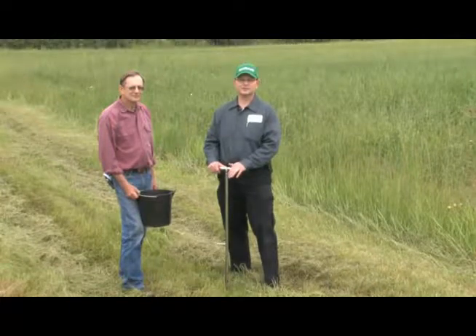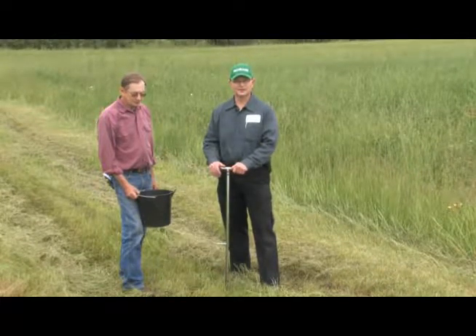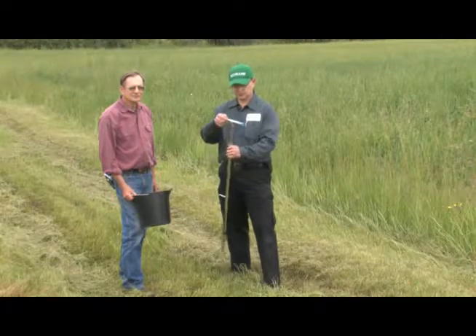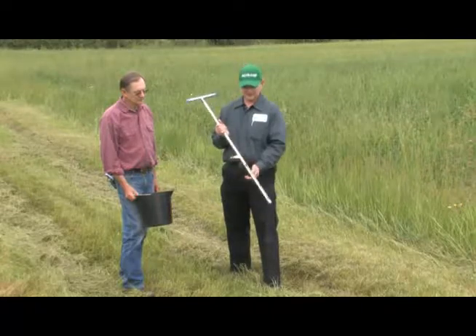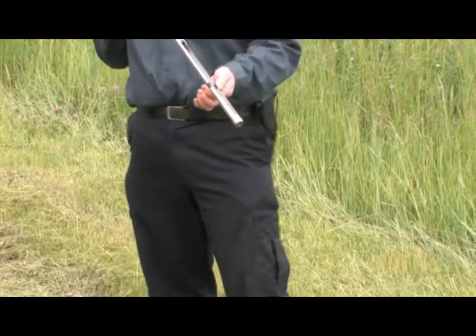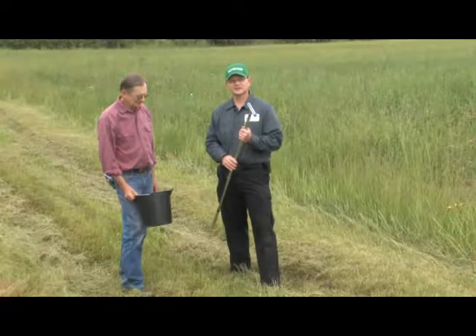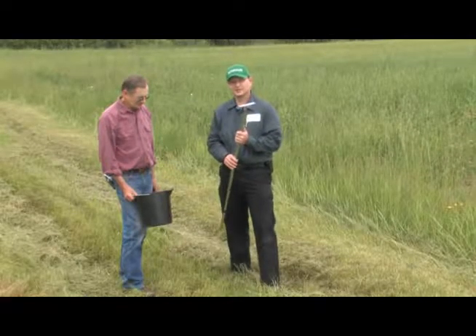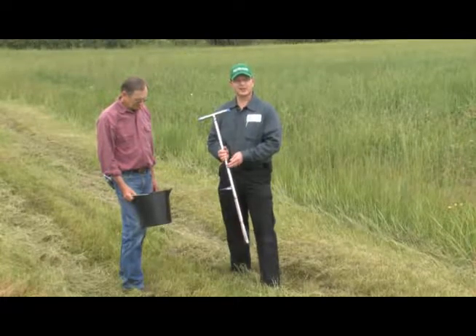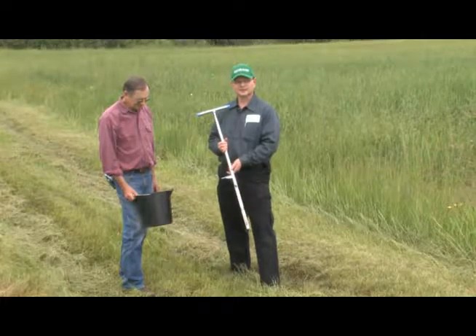One of the tools that you may find useful is a soil sample probe. You can obtain soil samples using a shovel or spade, but a soil sample probe, which I have in my hand right here, is marked off at 6 inches for a normal depth of a soil sample. These probes can be stainless steel, or chrome plated, or you can even make one yourself. But from an industrial or scientific supply house, you can obtain these for about $75 to $100.